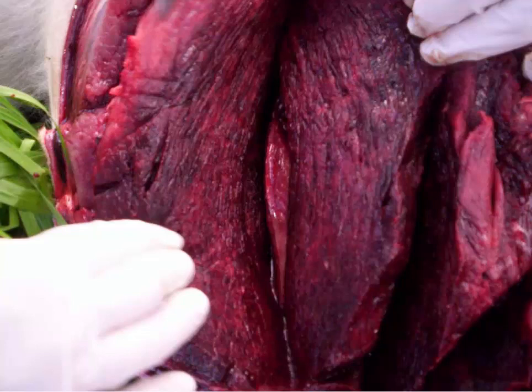Okay, we're back, and it's a lovely picture of Blackleg. The morphologic diagnosis that I prefer would be a focally extensive necrohemorrhagic rhabdomyositis. Rhabdomyositis meaning skeletal muscle. If you just said hemorrhagic myositis, you missed the boat on that, because this is really necrosis.